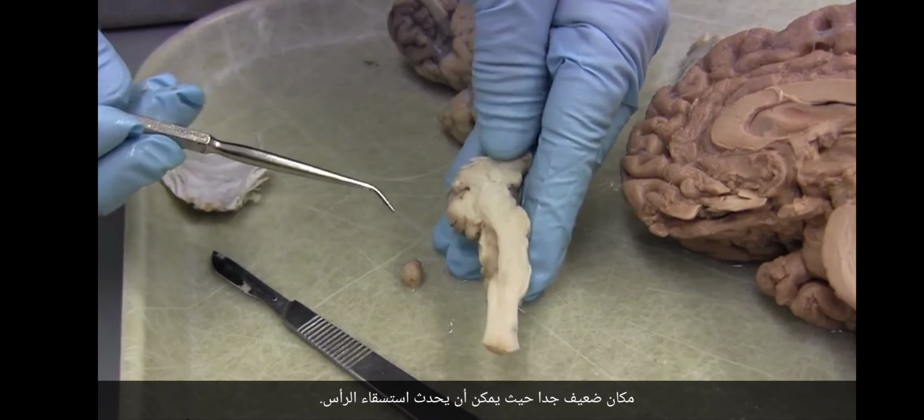Okay. So now let's follow the lateral ventricle, and there's no good way to do this except to sort of dissect it by tearing it. You can see it goes all the way forward to this frontal pole. Do you see that? That's the end of it. So it's going all the way forward, but the really cool part is as we go backwards. And so we're going to follow it as it goes backwards.